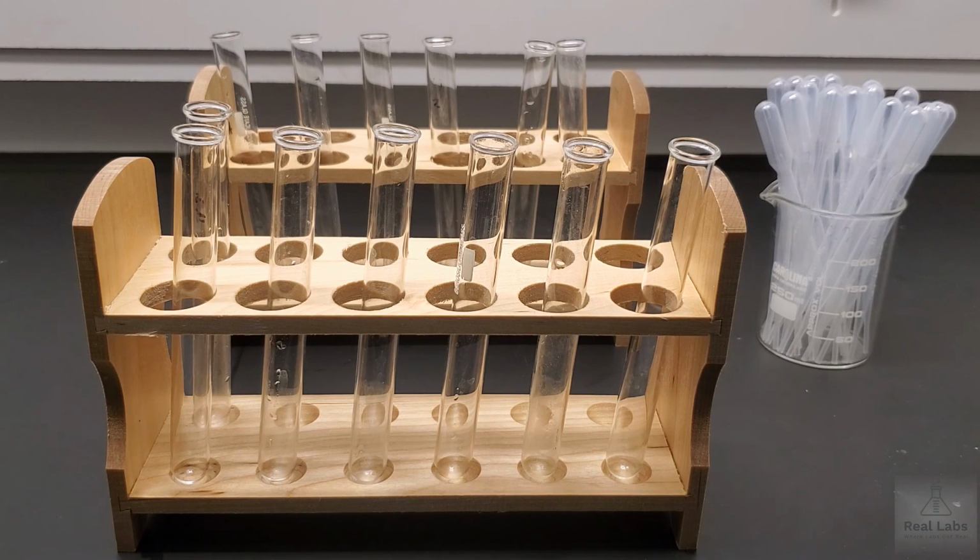In this lab, what we're going to do is run through a series of different binary reactions where we're basically going to take two individual ionic systems and put them in the same test tube and see what happens. As we go through this, you can pause and try to predict what you think will happen based on your understanding of double displacement reactions, or you can basically just watch the reaction and try to determine how or why or what the products are, what the net ionic reaction is, and so forth.